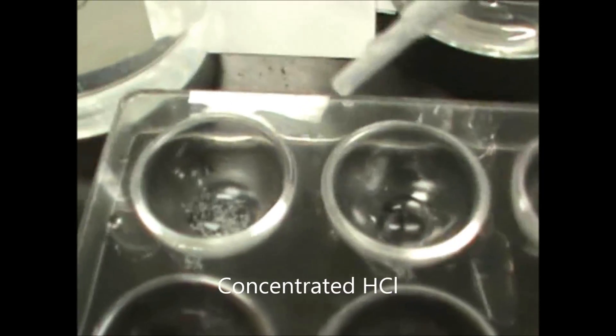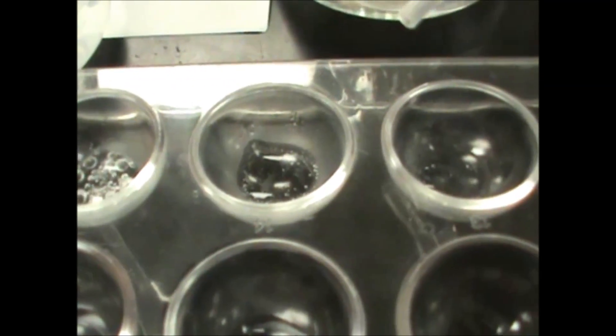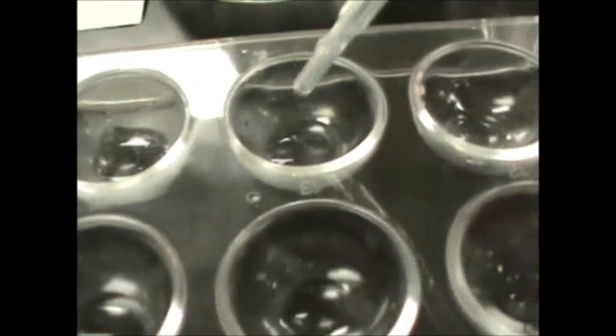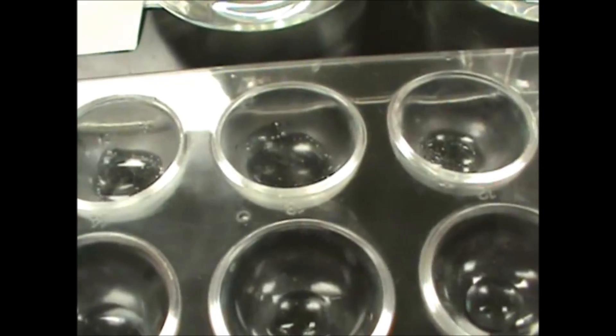When I add that to the carbonate and the bicarbonate, you should see a lot of bubbles forming, but when I add that to the hydroxide and the phosphate, there might be a little bit of bubbling, but it will not be as much as the other ones.